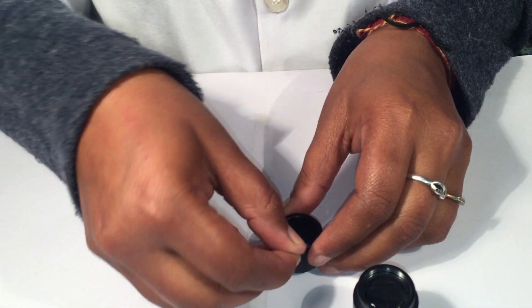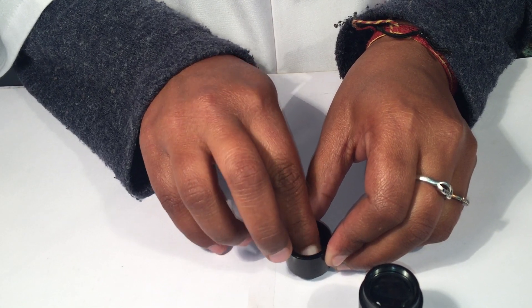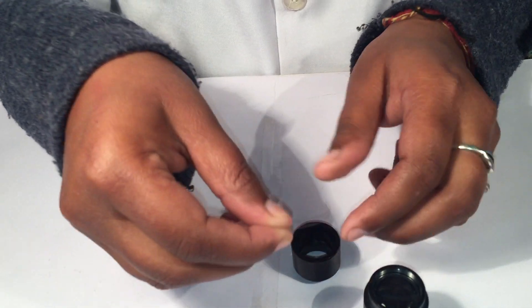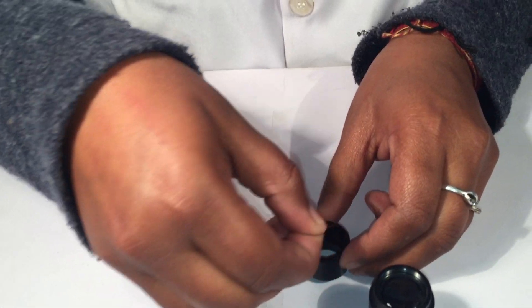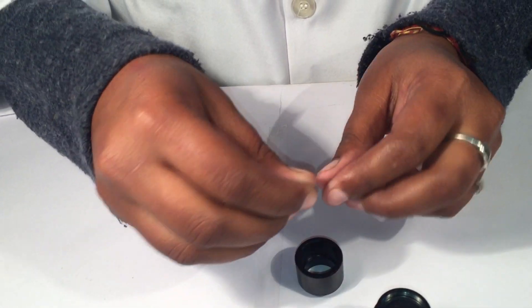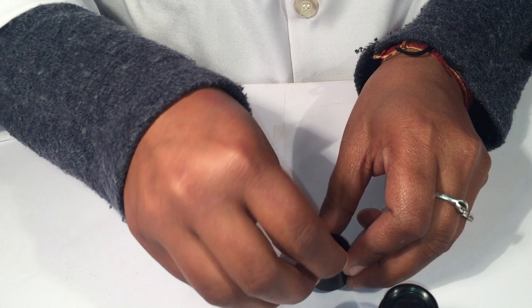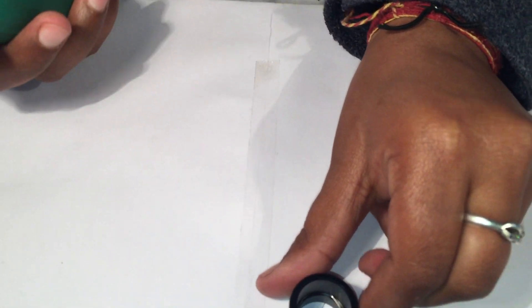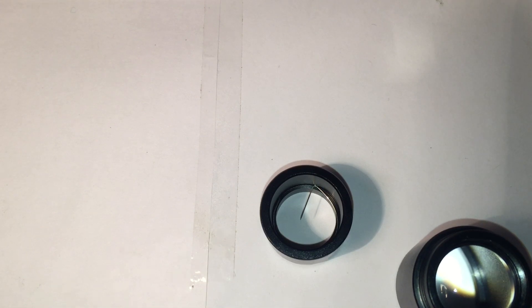Now we have to be a bit cautious in putting the pointer as it's a very thin pin. Okay, so can we just see? The pointer has been placed. I'll just focus... yeah, we can see that.